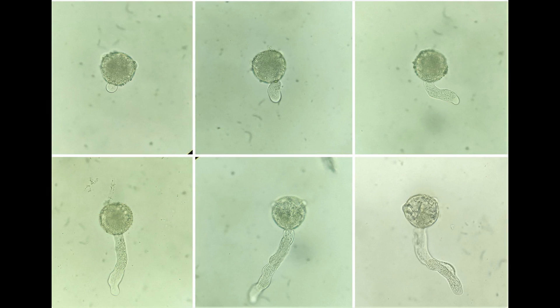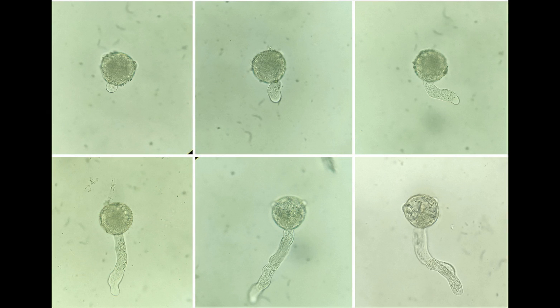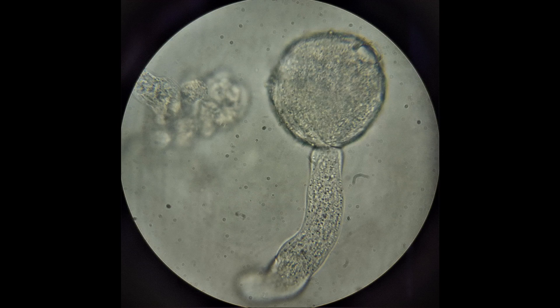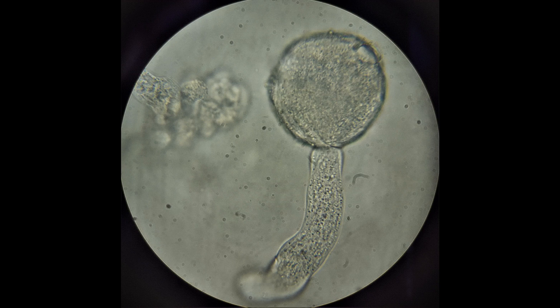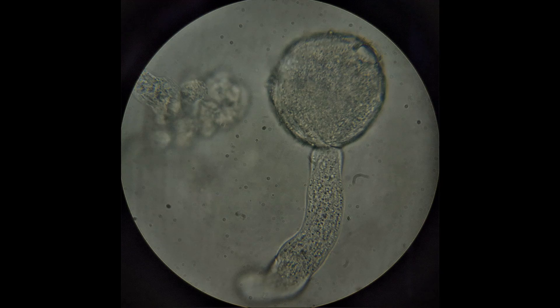Leave the slide for several minutes and observe again. By now, you'll notice one short tube emerging from each of the pollen grains. As time progresses, the tube will gradually elongate. If you observe one of the pollen grains under high power of the microscope, you may be able to notice the pollen tube nucleus along with two smaller sperm nuclei at the tip of the pollen tubes. The two sperm nuclei or male gametes are a result of the division of the generative nucleus after the pollen grain germinates into a pollen tube.